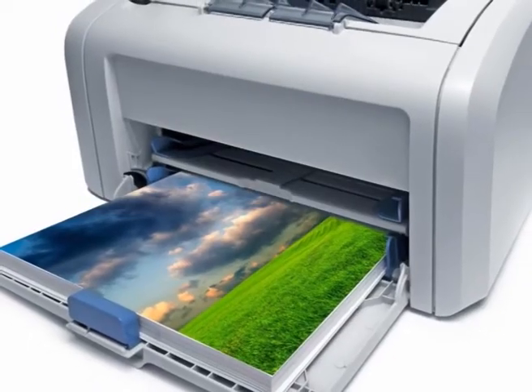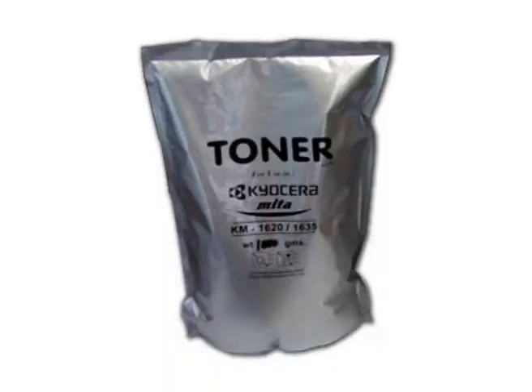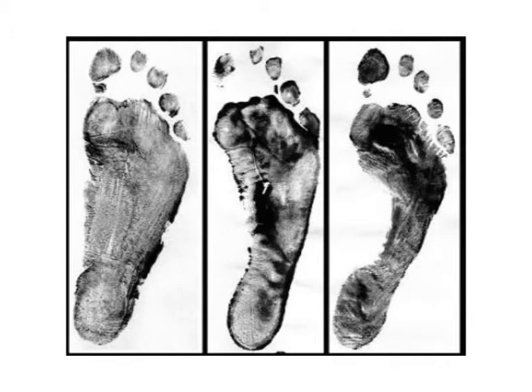ESDA takes advantage of the technology used in copying machines and laser printers to help visualize the indented writing. A sheet of thin plastic is placed over the paper with suspected indented writing, and both are placed in a vacuum chamber. A charge of static electricity is imparted to the plastic, then toner powder is applied to its surface. An image of the indented writing is created on the plastic, with the advantage that the original paper is not altered or damaged. ESDA methods can also be used to lift footprints in dust.